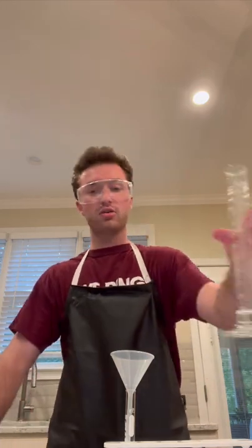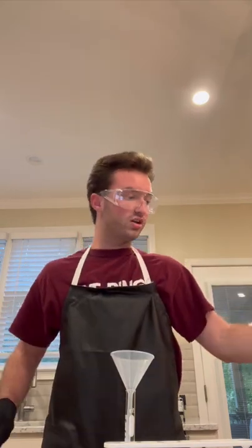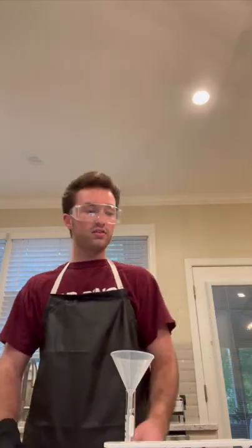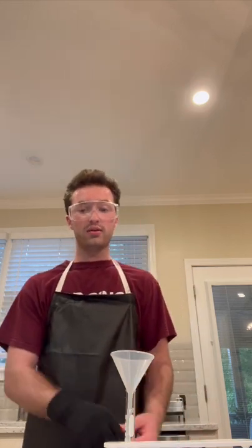And then from there, once I get it into my test tube, I'll be using 10 milliliters of distilled water, which I already also have measured out. So I'll be pouring that into the test tube and then using my stirring rod to properly dissolve the CuSO4. And once it is fully dissolved, I will be storing it properly until it is time for the reaction. So I'm going to fast forward while I get my cupric sulfate prepared, and I'll be back in a minute.